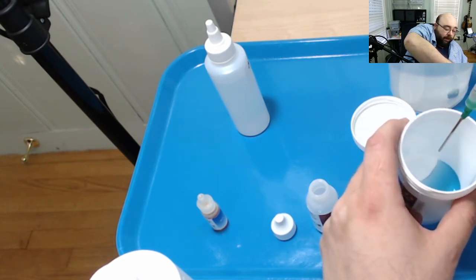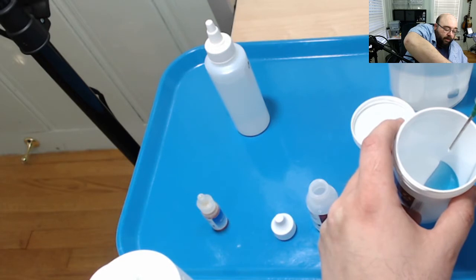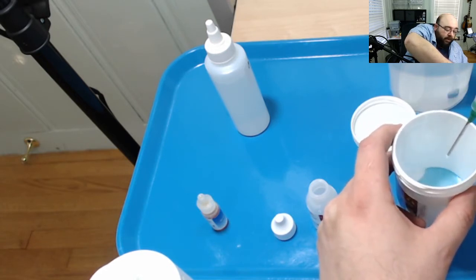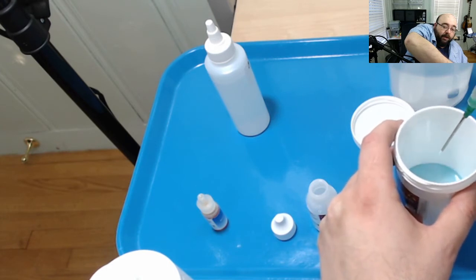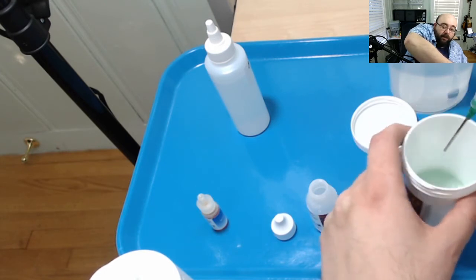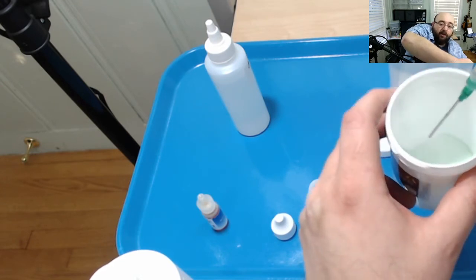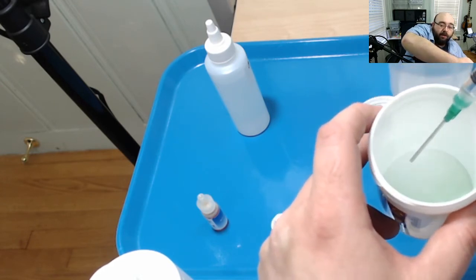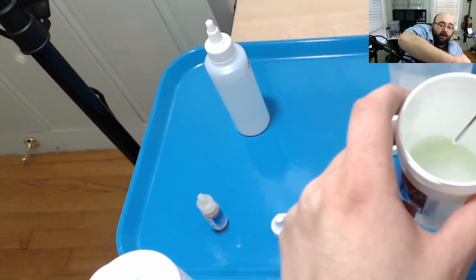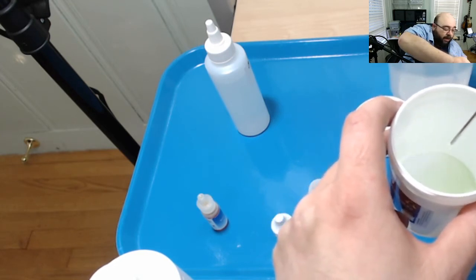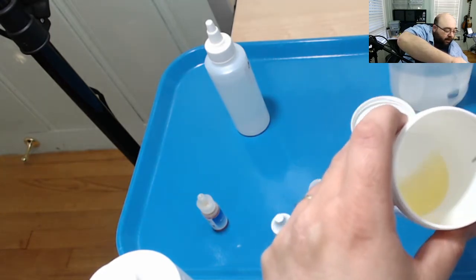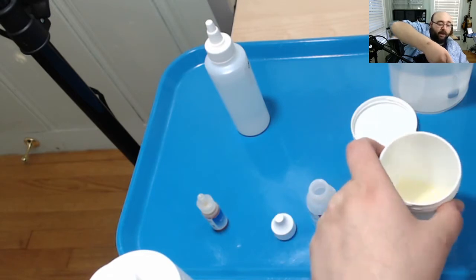Still blue, but a little more green. Getting more green. Getting more green. Getting quite green there. There's still a blue tint to it though. Tiny bit more. Getting definitely yellow now. And there we go. It just went all the way to yellow.